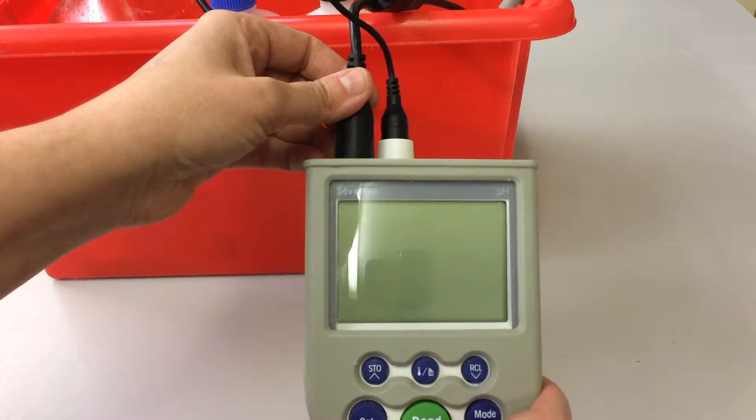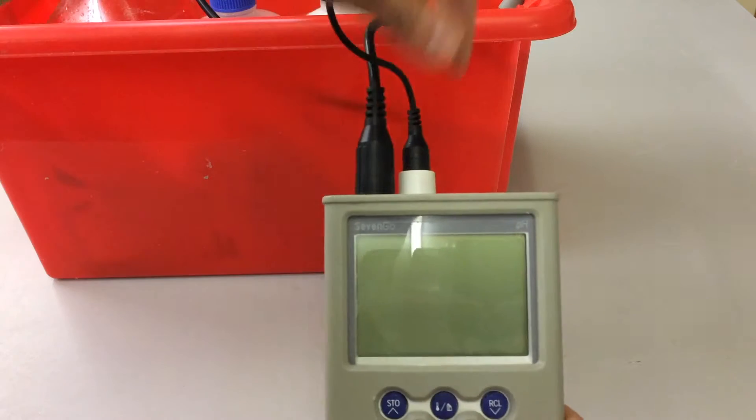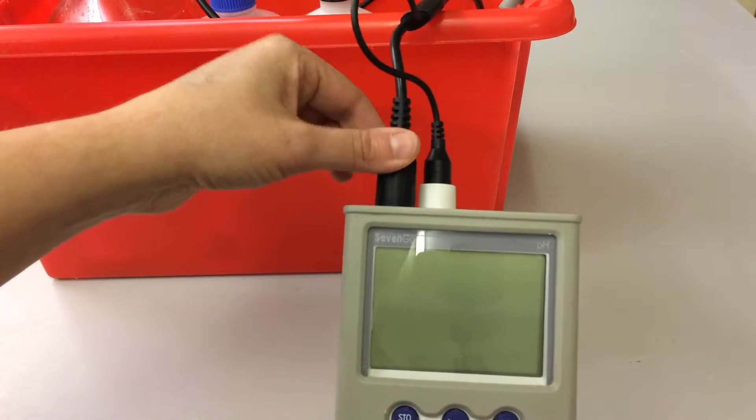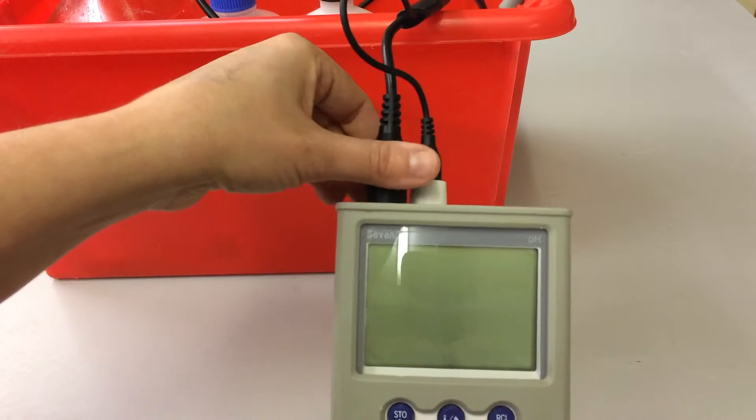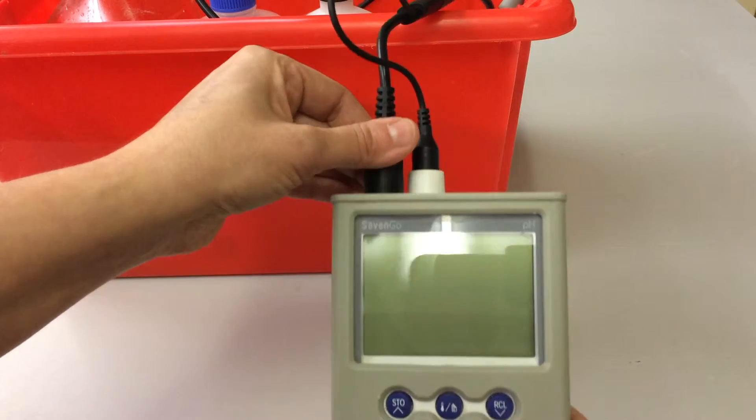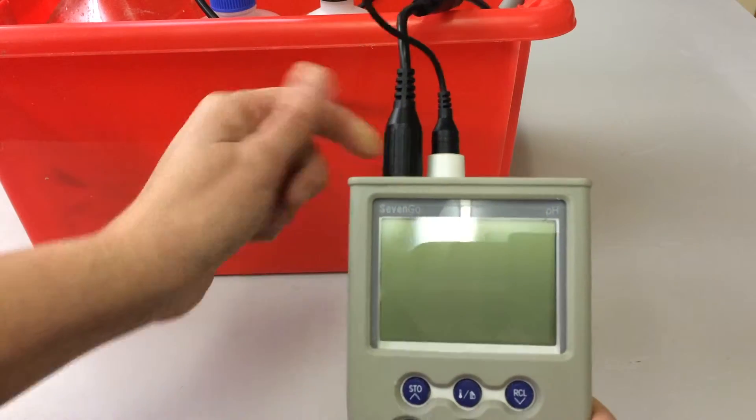This is the temperature section here and this is the pH meter connection here. So when you do go to use this piece of kit, it's always worth just making sure that those are secured very well before you switch it on.